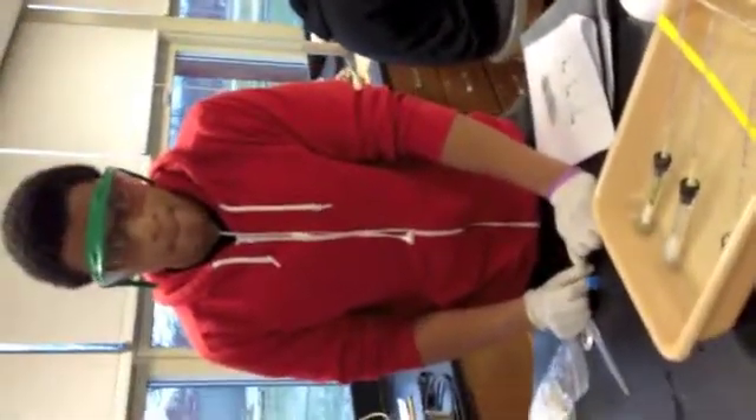We only have about one minute left of the seven minutes. Now we're going to put food coloring in the tip of these and then put them into the water. We have to take a reading at zero. We were just moving the pipettes and some of the blue dye came out and dispersed through the water, so I think that'll lead to some human error. But the measurement didn't change, so it might be okay. We'll find out later.